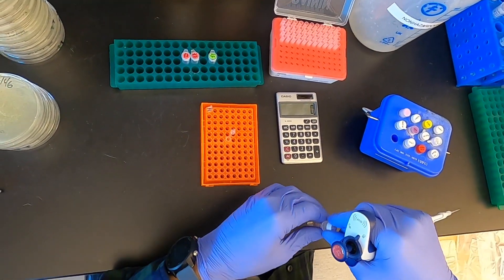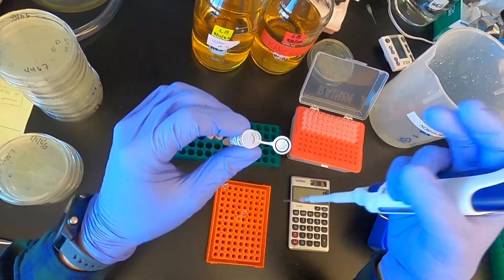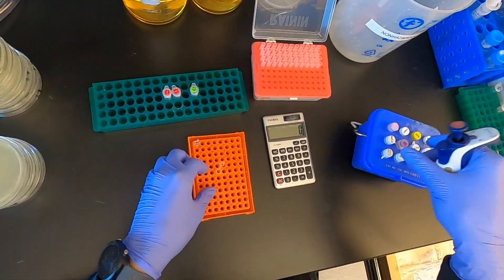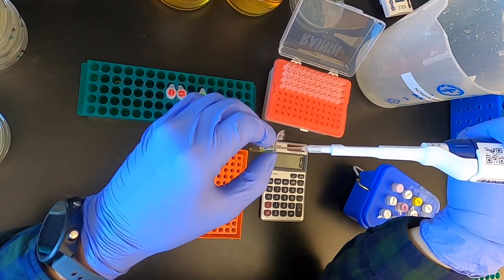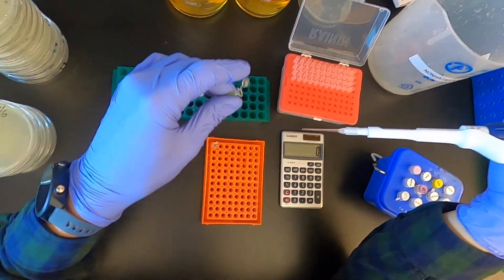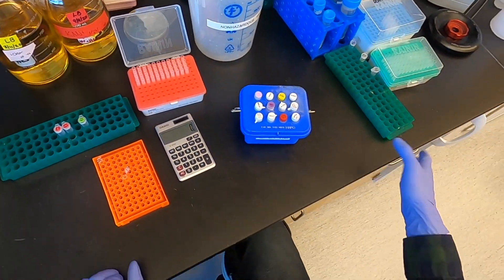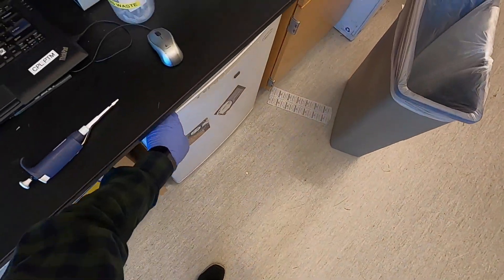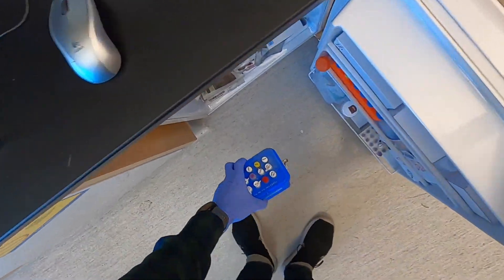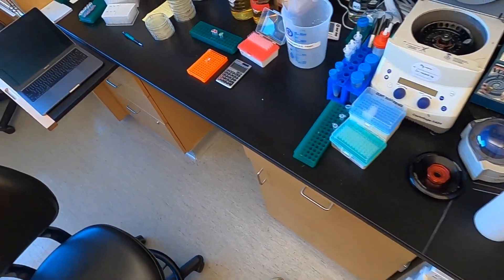Followed by my T4 DNA ligase. Okay. And then I'm going to immediately put these enzymes back in the freezer because they need to be kept at minus 20 to preserve their activity.